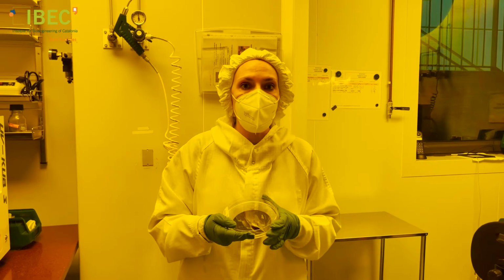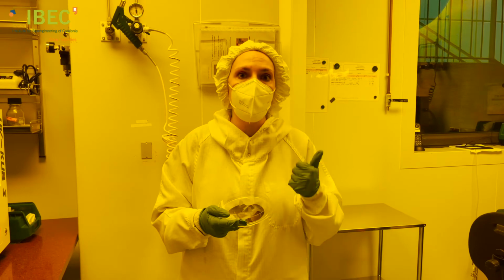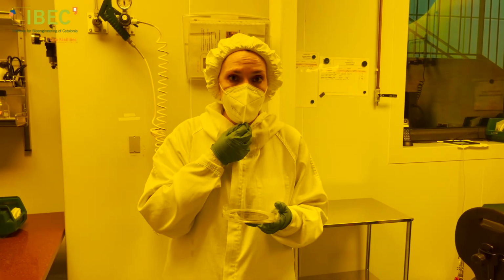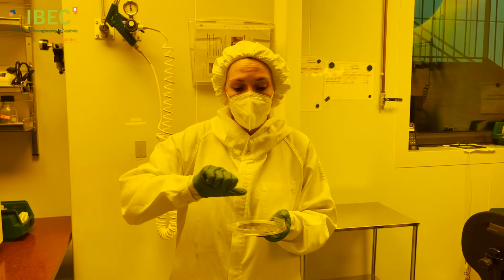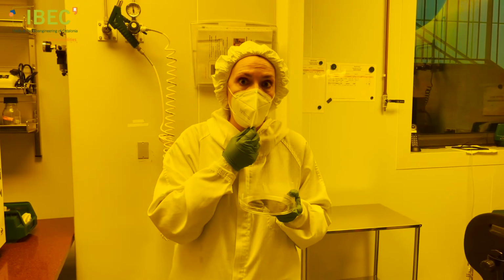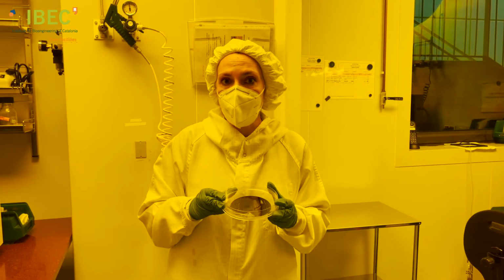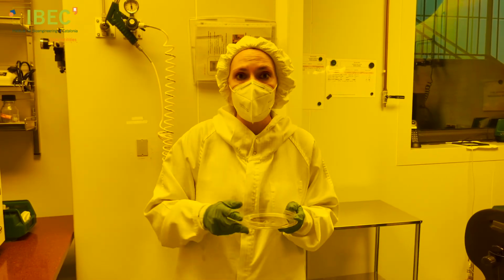The chips that we fabricate here are made of PDMS, which is a polymer, transparent, flexible, and biocompatible. What we do is take these masters, we pour the PDMS, and after a process of curing, it becomes hard, solid. And we peel it off from these masters, getting replicas from the masters in this polymer. Before pouring the PDMS, we treat these masters with a silane treatment, which is anti-adhesive, which is beneficial to peel these replicas easily from the masters.